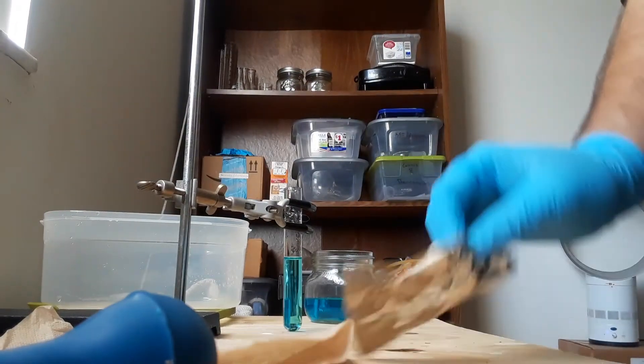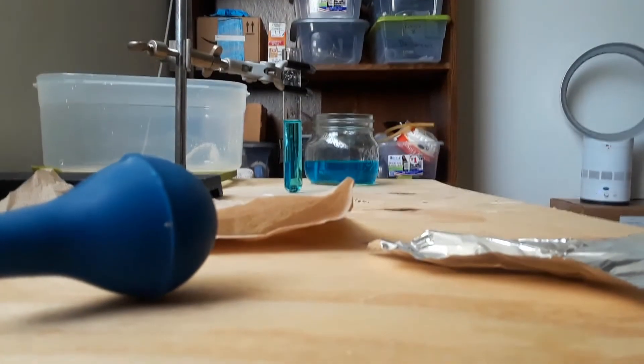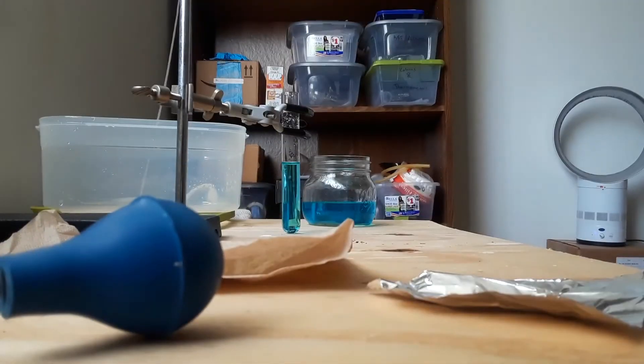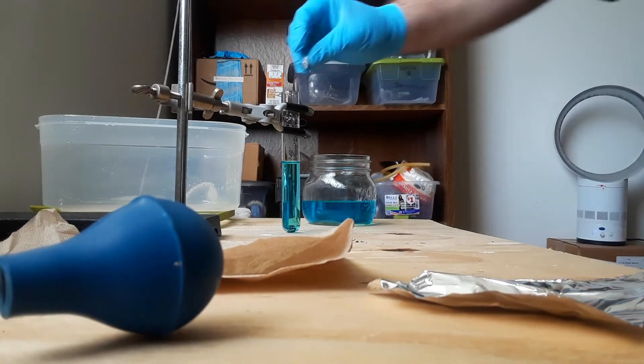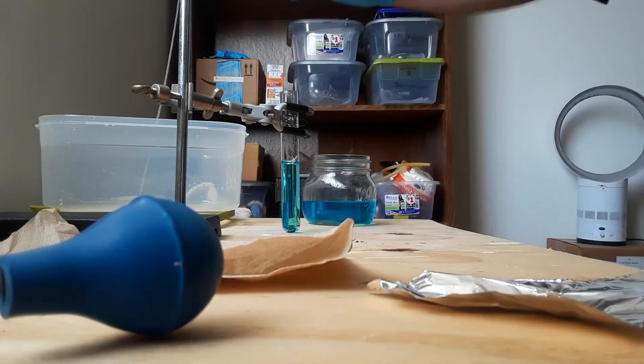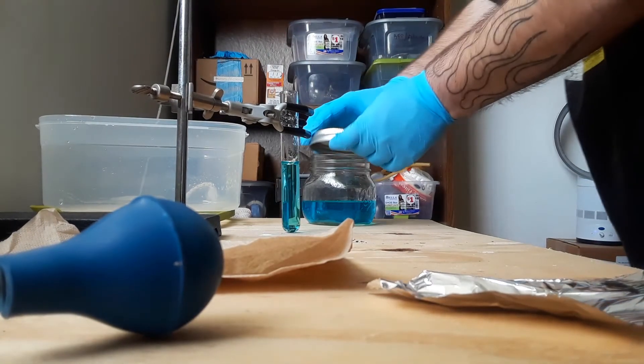I'll add a little bit of foil in small portions. Can I see the test tube from here? Yes, now I can. Alright, we're adding the aluminum foil. I don't know how long it'll take to react, but it doesn't look that big.